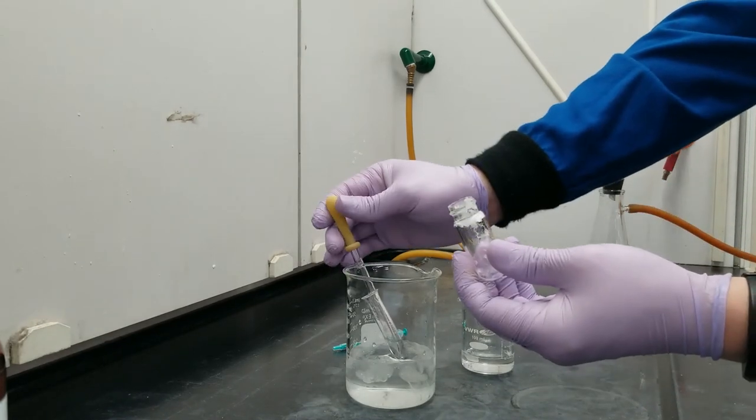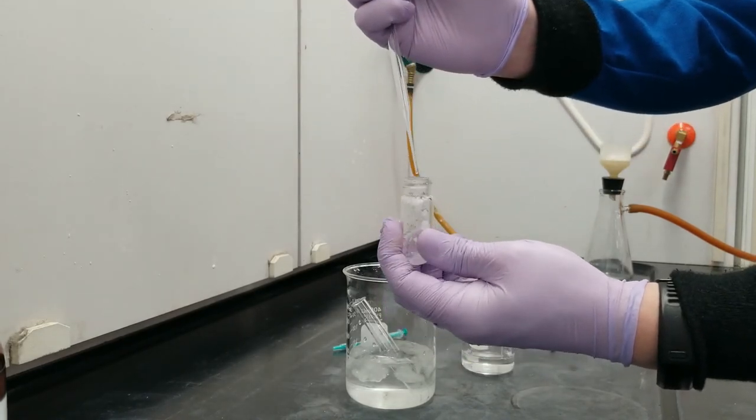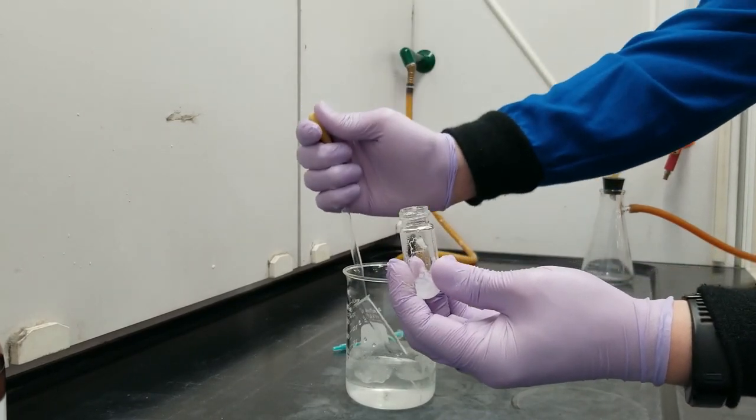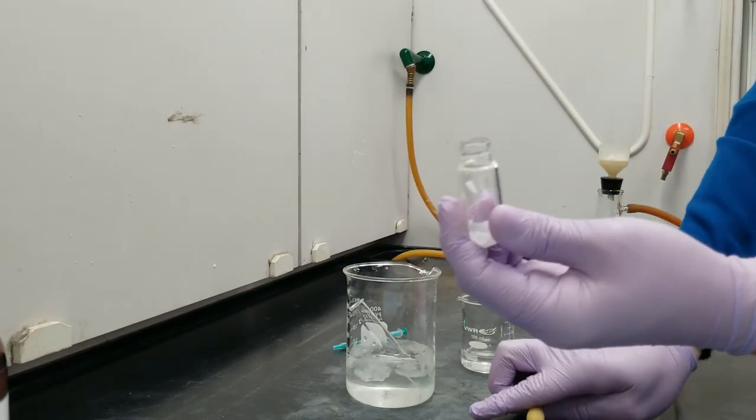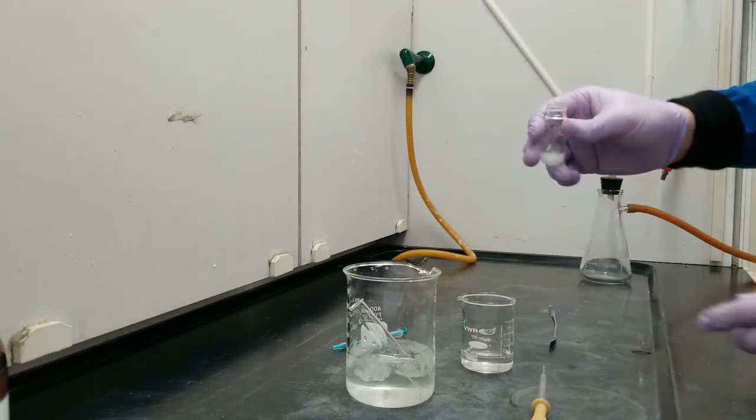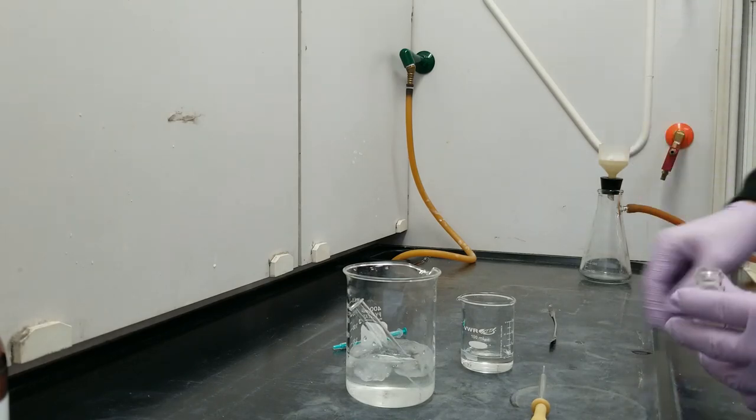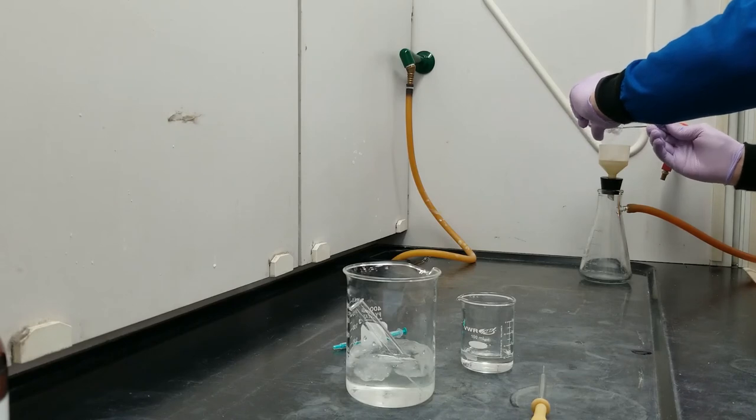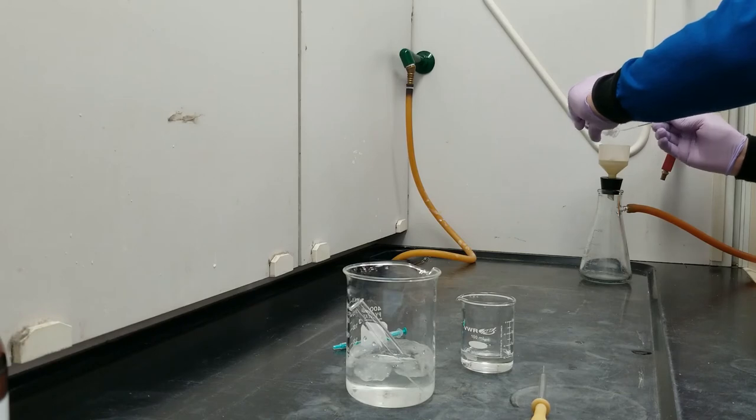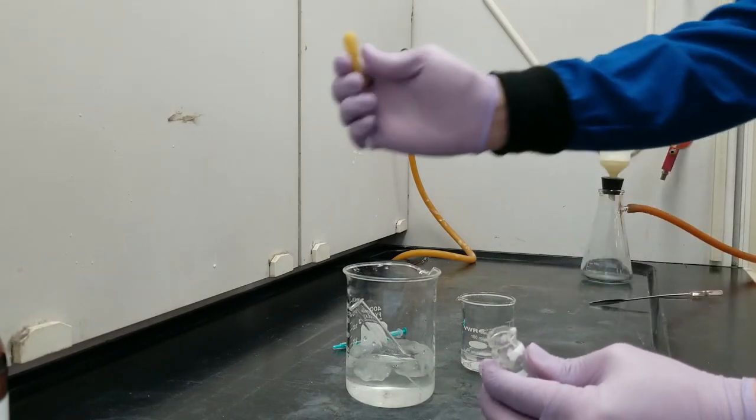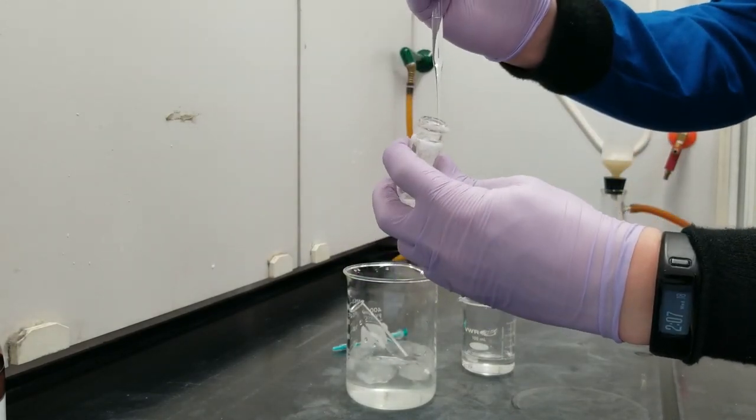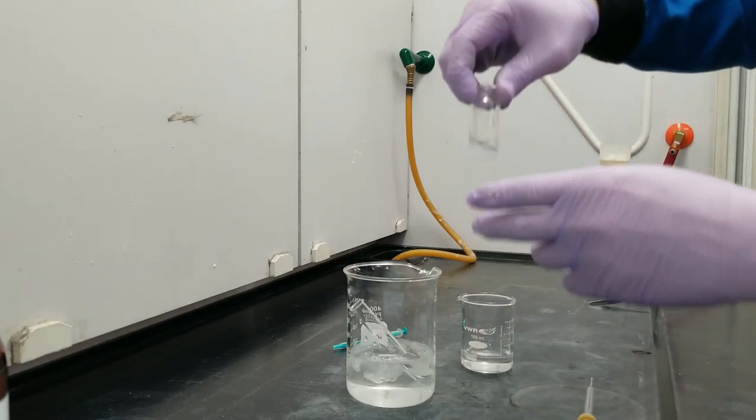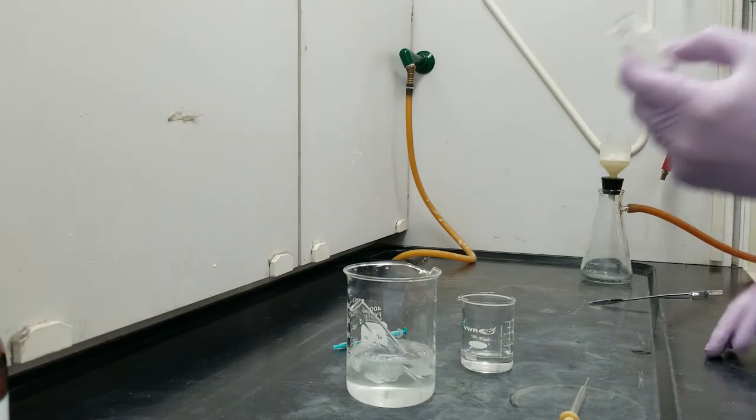I did my best. Let's use cold petroleum ether washes to try to get the rest out. Now, I said that diethyl ether was good at dissolving everything during the reaction period, but we're switching to petroleum ether in this step because I don't want to dissolve the product anymore. I want the product to stay solid so that I can collect it. Let's give it one more go. That's pretty clean. It's not bad.